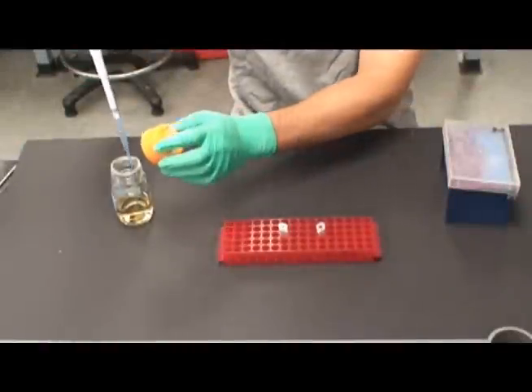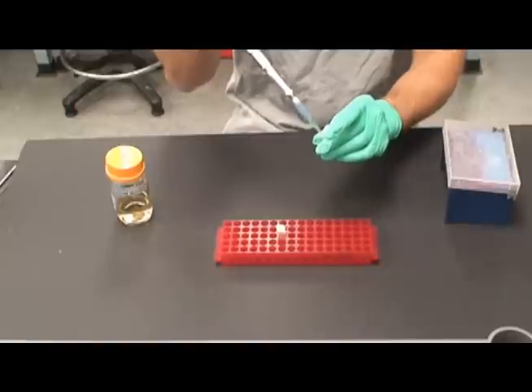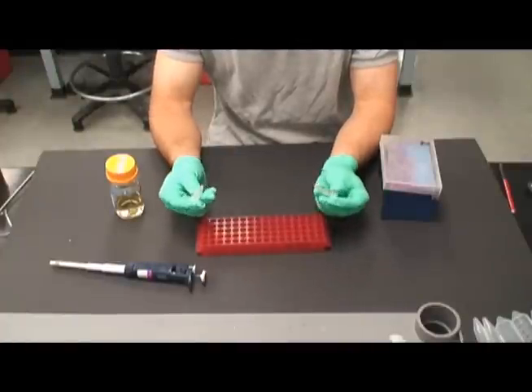Next, add 0.5 milliliters of LB medium to each of the competent cell tubes. Mix these tubes gently.